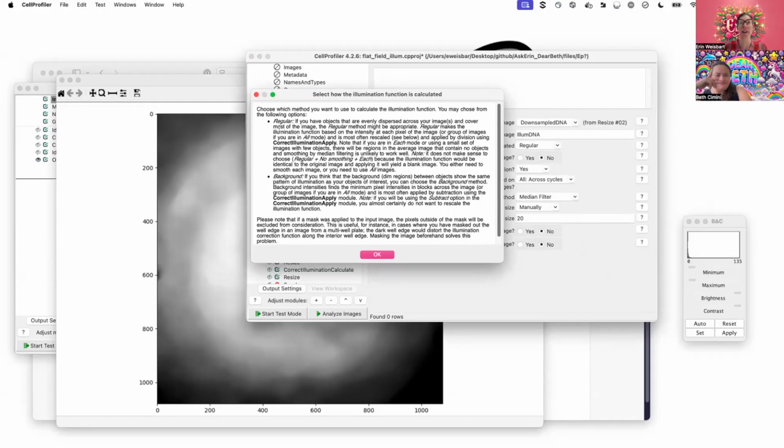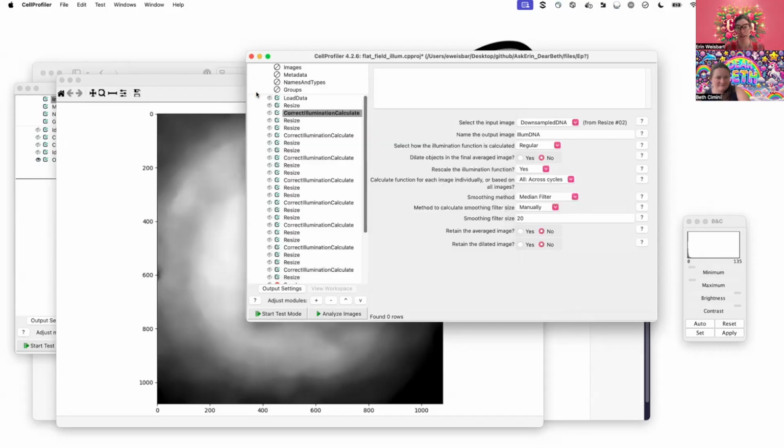So regular refers to images that have these objects across. It even gives you some extra information, reminding you what you should pick in other settings if you have picked regular. So when in doubt, read the docs in CellProfiler. We're really proud of the docs. They're very important to us.